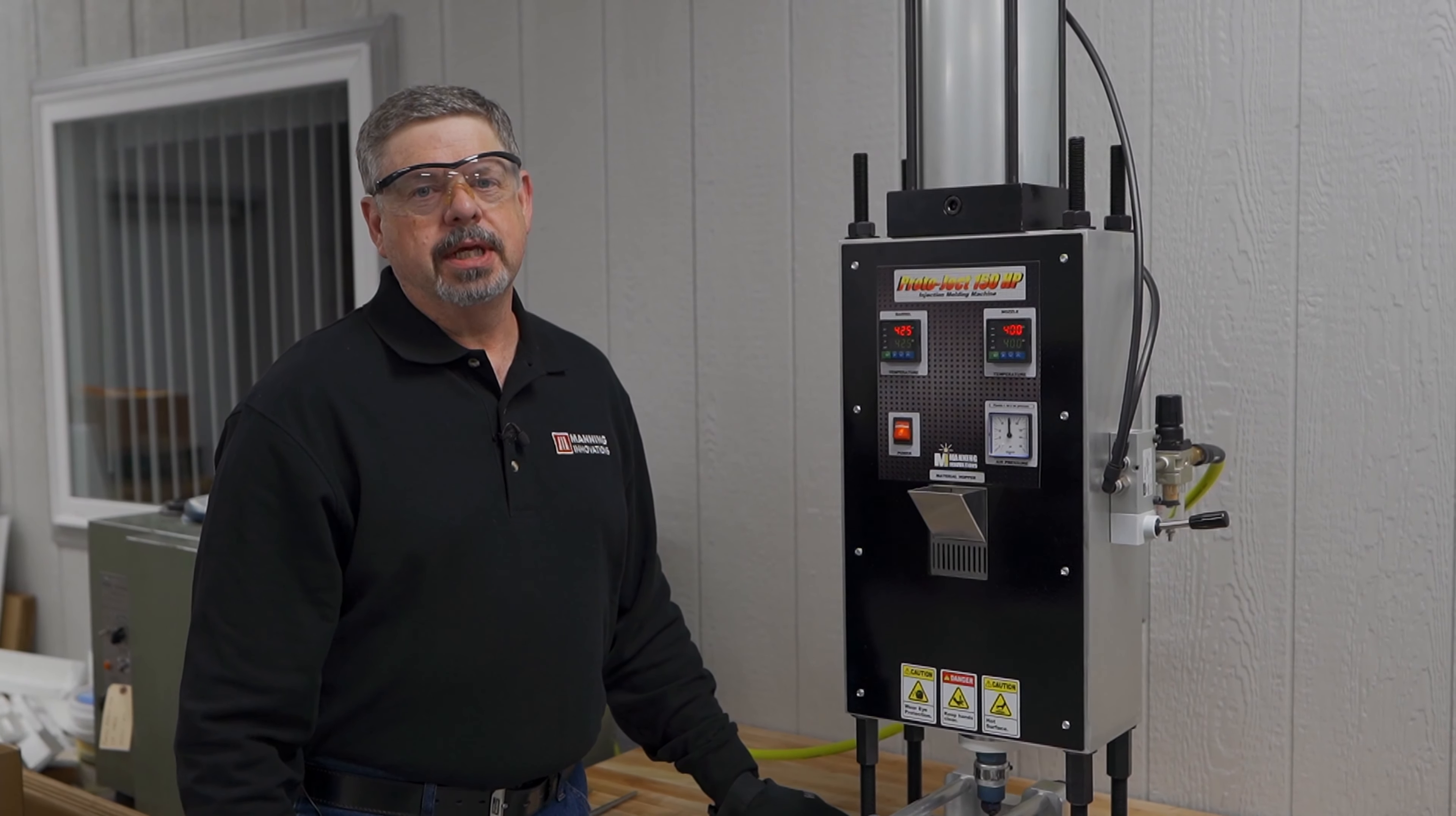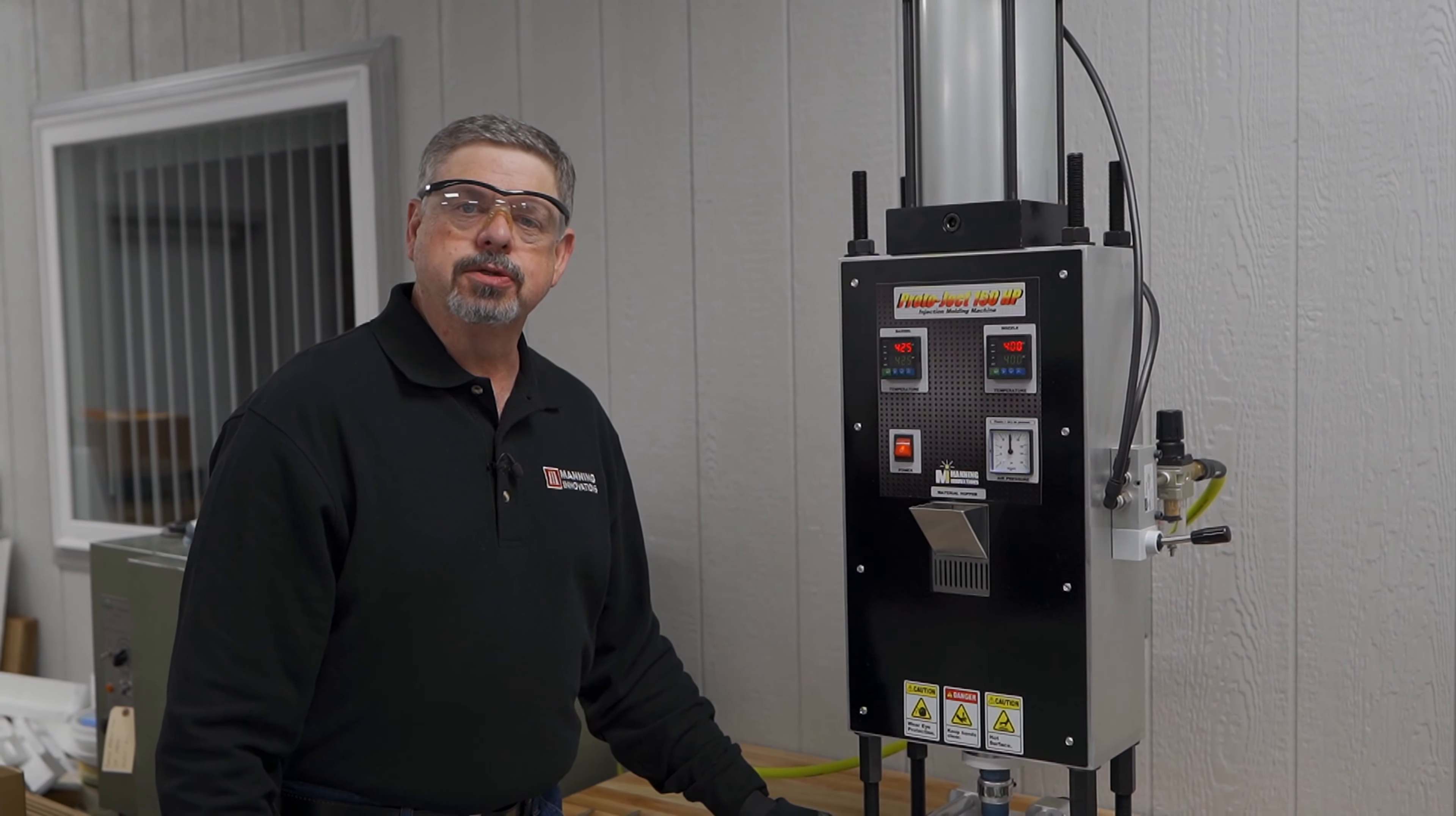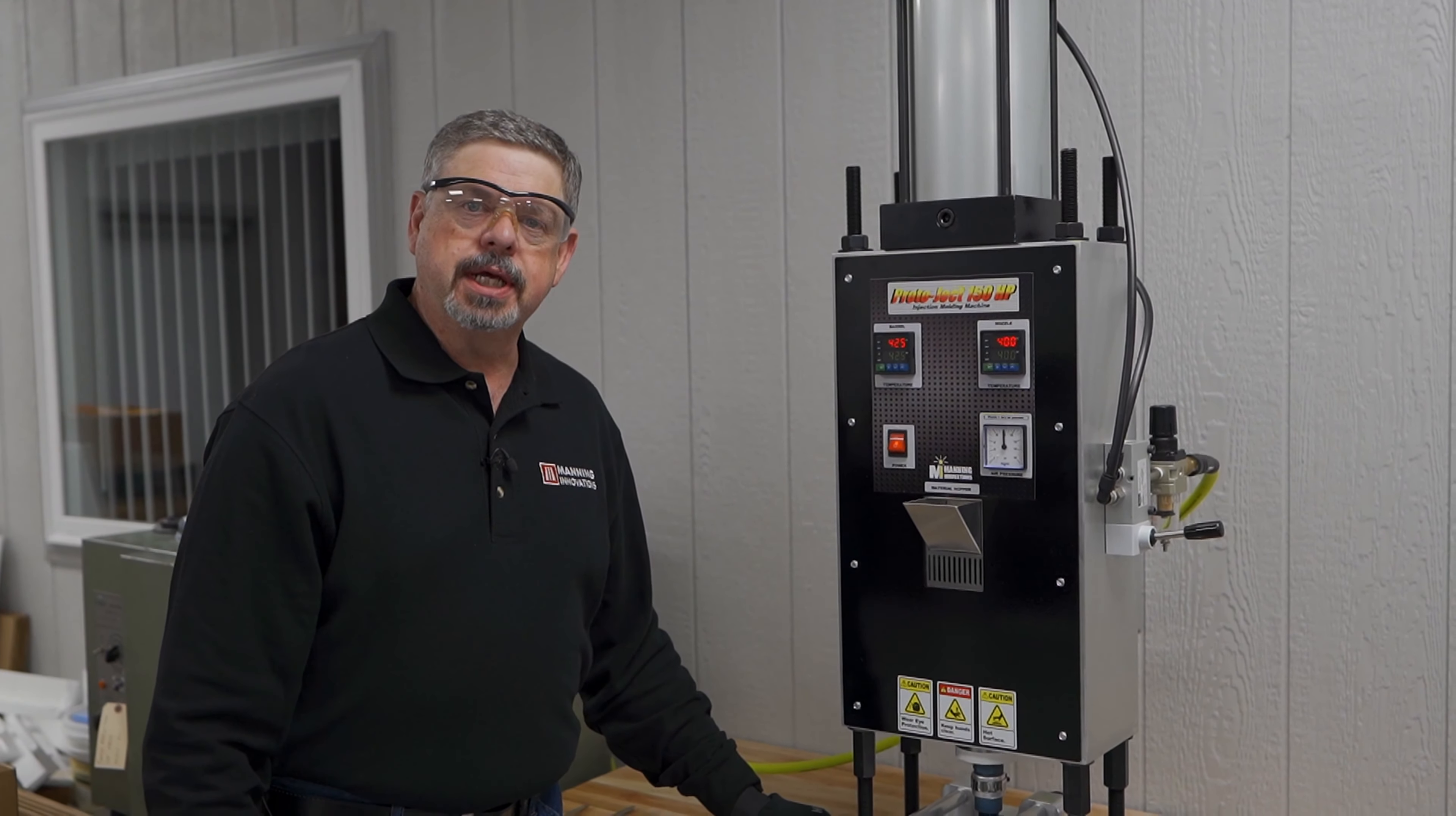Hi, I'm Richie with Manning Innovations, and today we're going to be shooting a tensile test bar specimen. Specifically, this is an ASTM designation 638-14 type 4 tensile test specimen, also called a dog bone by many.